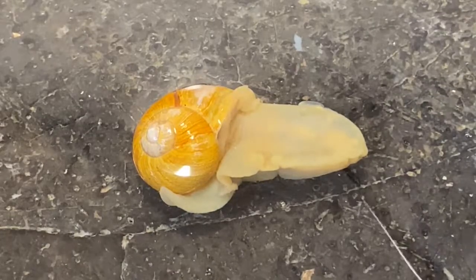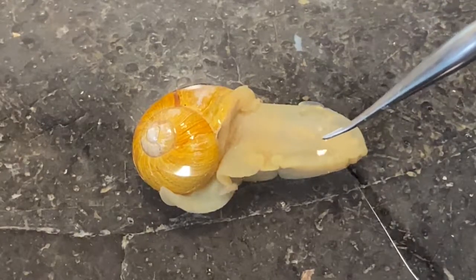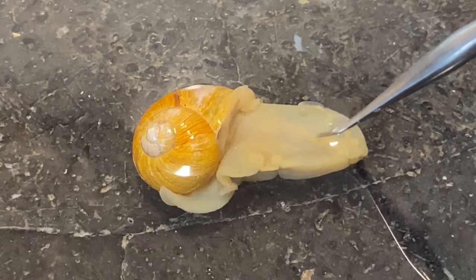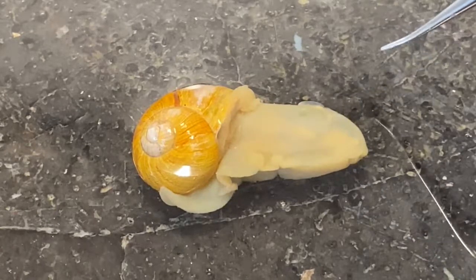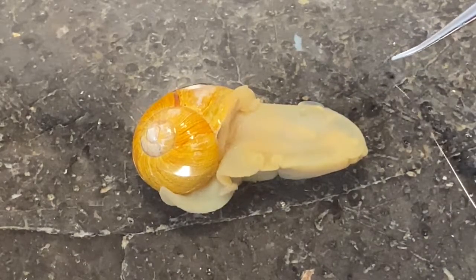On the right hand side of the body, this little spot right here — you see a little bit lighter color — that is the genital pore, or the genital opening.